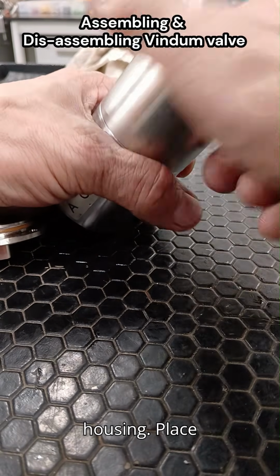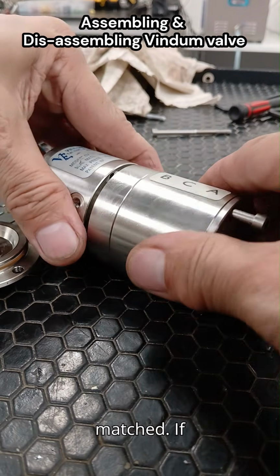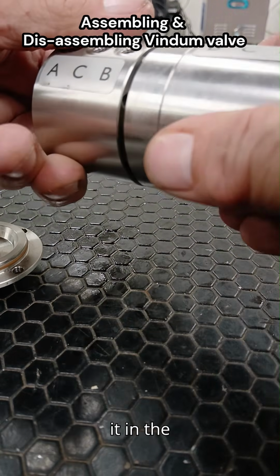Align the housing. Place the top housing or cap onto the valve body. Ensure dowel pins or alignment marks are matched. If the design uses a thrust bearing or washer, insert it in the correct order.